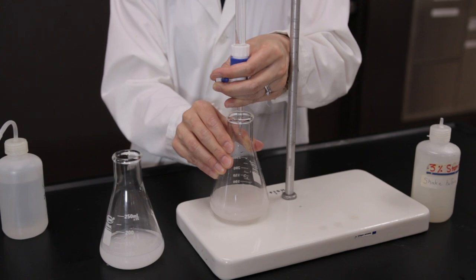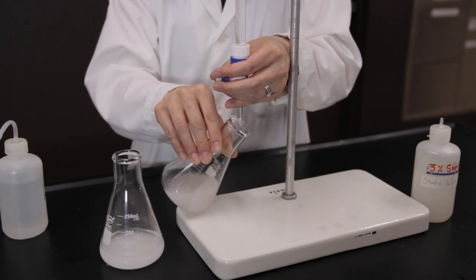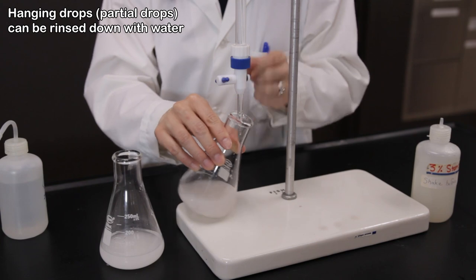At the end point, record the final burette reading, again be sure to record to two decimal places.